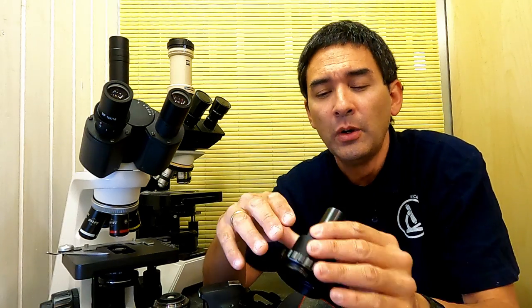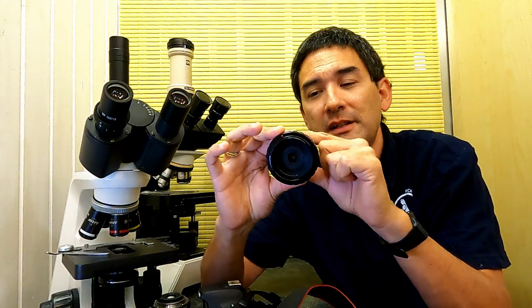So this kind of was the idea, I thought. Otherwise, there is going to be too much internal reflection and you will lack in contrast. But now we have a solution here that essentially by turning this, you are able to step it down. You're able to limit the light only to the area that you actually see. And then you have a better contrast. Doesn't work. Okay. It's just going to make the field of view smaller, but it doesn't do anything else.